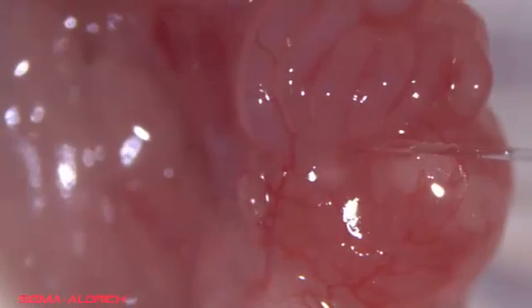With the infundibulum exposed, insert the glass capillary containing the embryos to be transferred and eject them completely into the oviduct. The injection of air bubbles behind the embryos is used as confirmation of a successful embryo transfer.